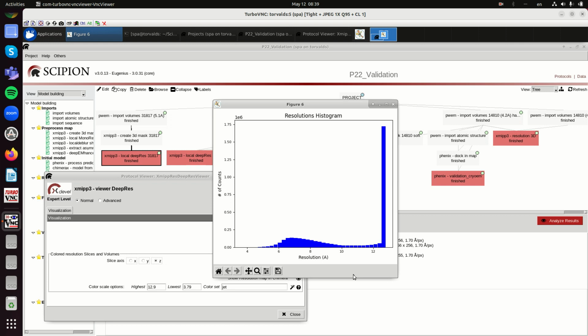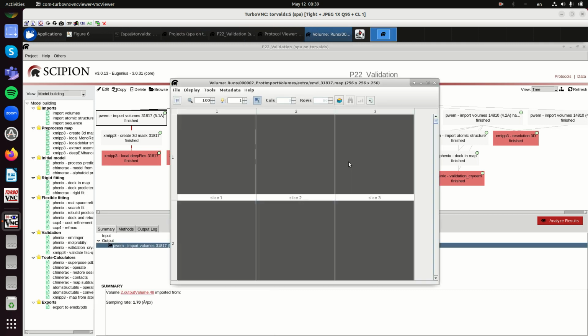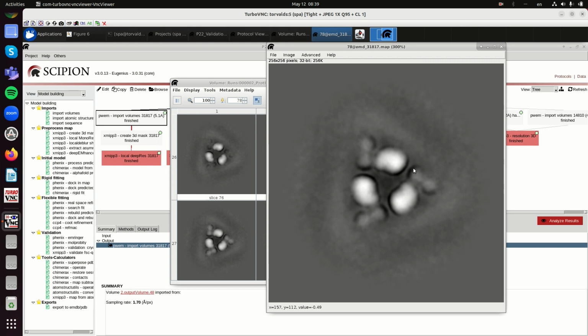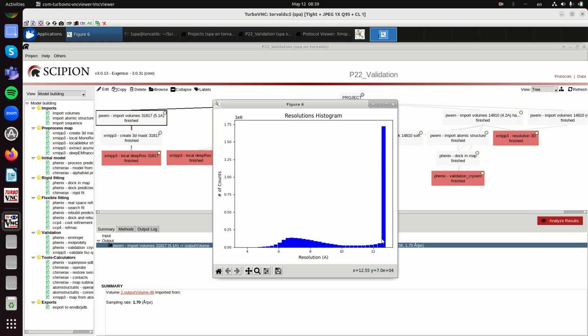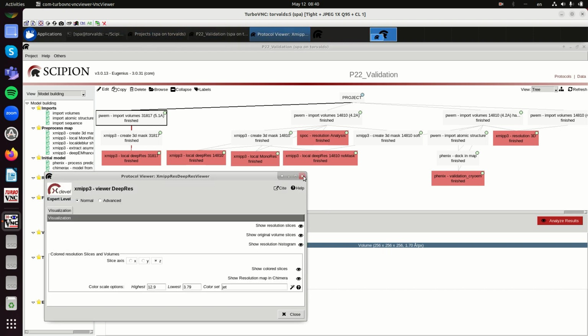But in this example, this very high resolution has been caused by high frequency oscillations. We see here high frequency oscillations that might be consistent between the two halves, and those are the ones that have been detected by the FSC. So here the histogram says it is 12 something or even 13 something, so it is very low resolution. There is some peak around 7, but this is not coming from the structure, but from these artifacts around. And so don't believe blindly the 5.1 angstrom FSC resolution. Okay, so this is one. Let me close everything. Okay, so another example.